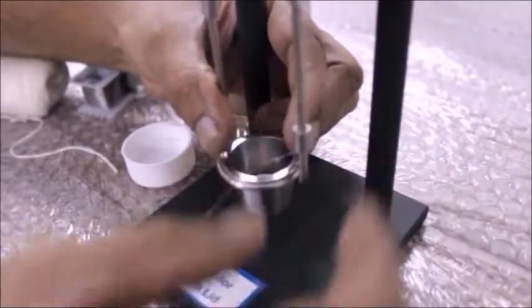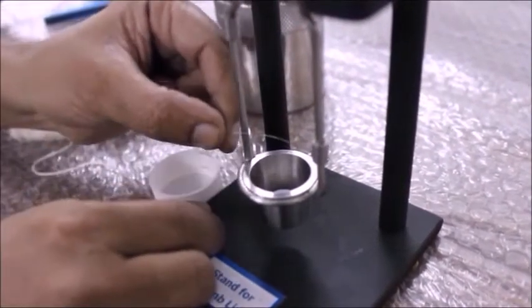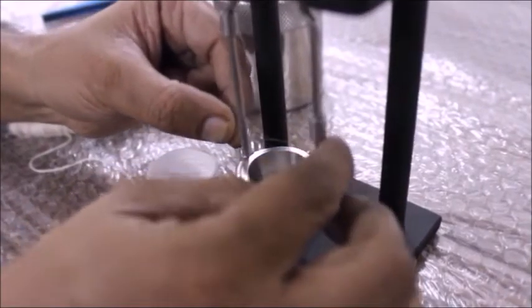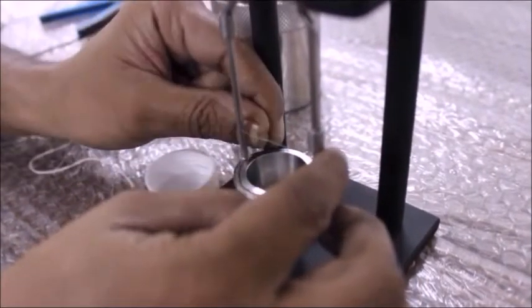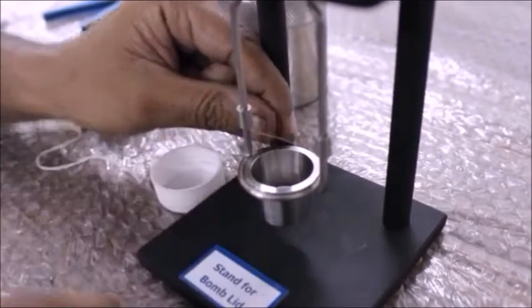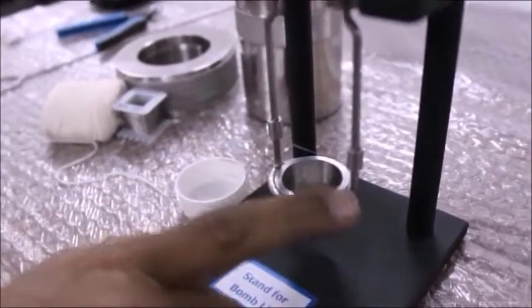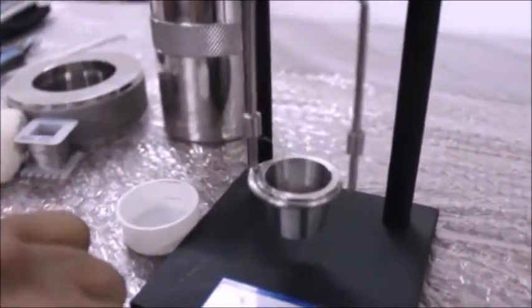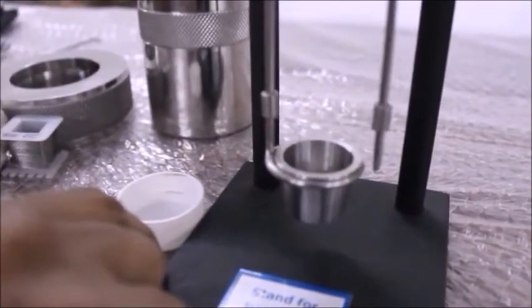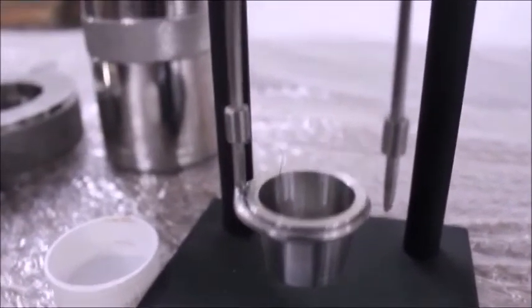Use the rings to make sure the wire is tight and that the wire will not be displaced during the experiment. This is how the wire should look like.